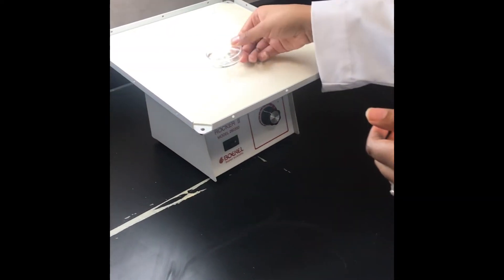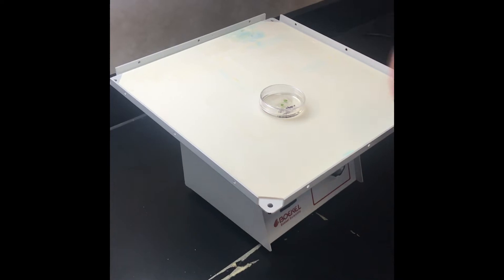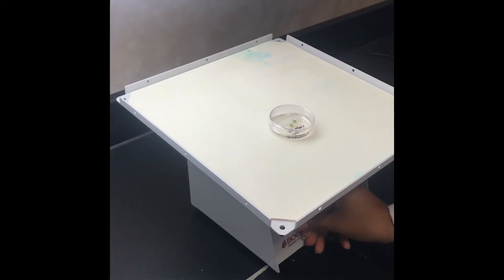So now we're going to place it on this shaker under light and shake it for approximately 20 minutes to an hour.